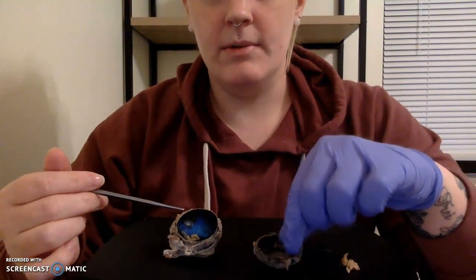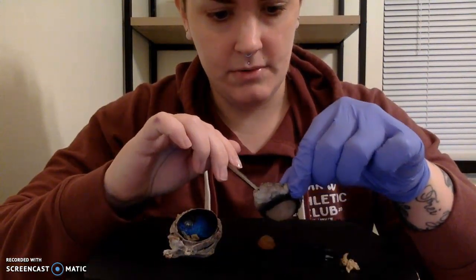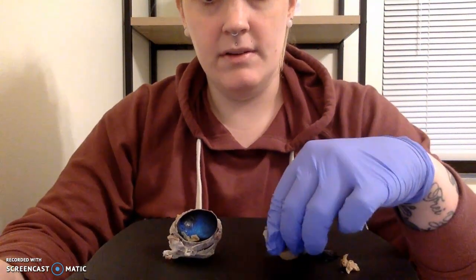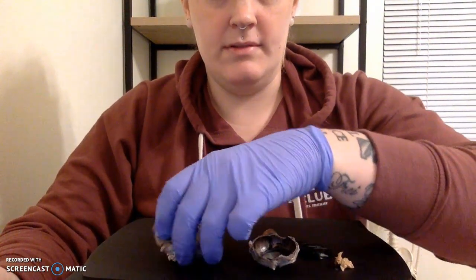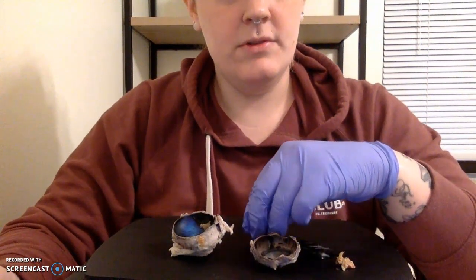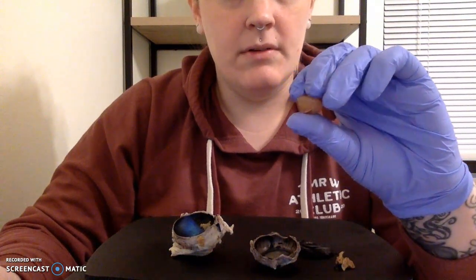The next item I want to look at is the pupil that also sits right in front of that lens. It is right here on our dissected eye. So you can see that I've divided our eye into our anterior cavity and posterior cavity. Our anterior cavity is going to be this structure right here, and then our posterior cavity is going to be this larger part that I have broken up into two pieces that is going to be the back of the eye.